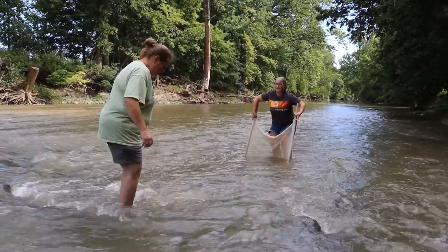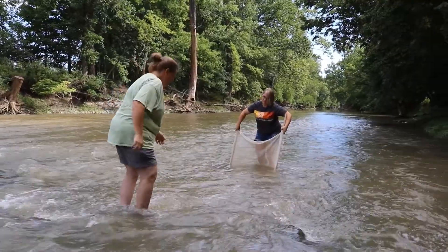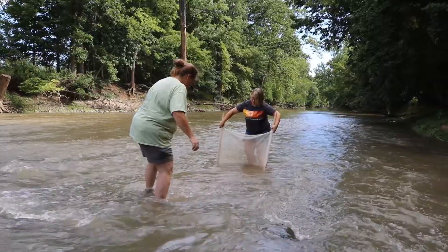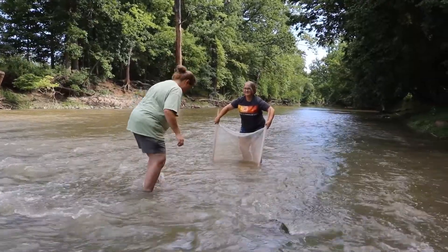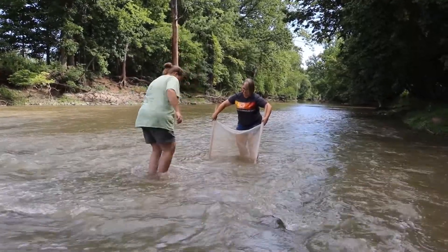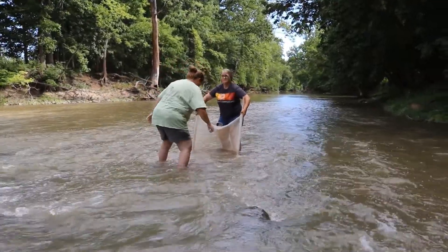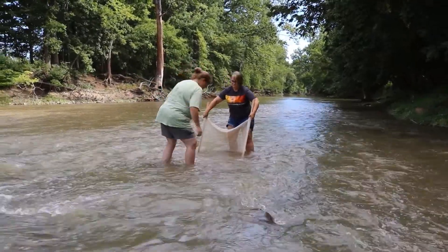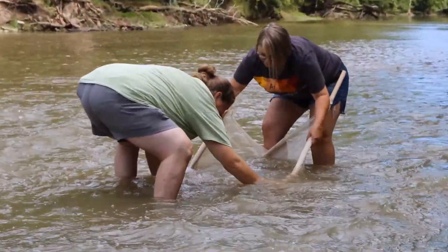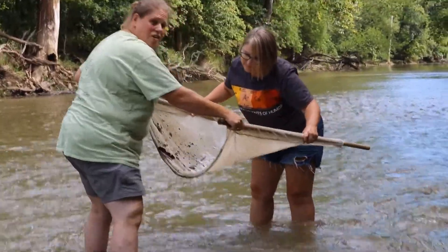When kick seining, you just want to go in and stir up all the gravel so it goes right into the net. Usually you have multiple people so nothing can get away. You want to take all the rocks and disturb their habitat. When you get to the end, you can see what you have.